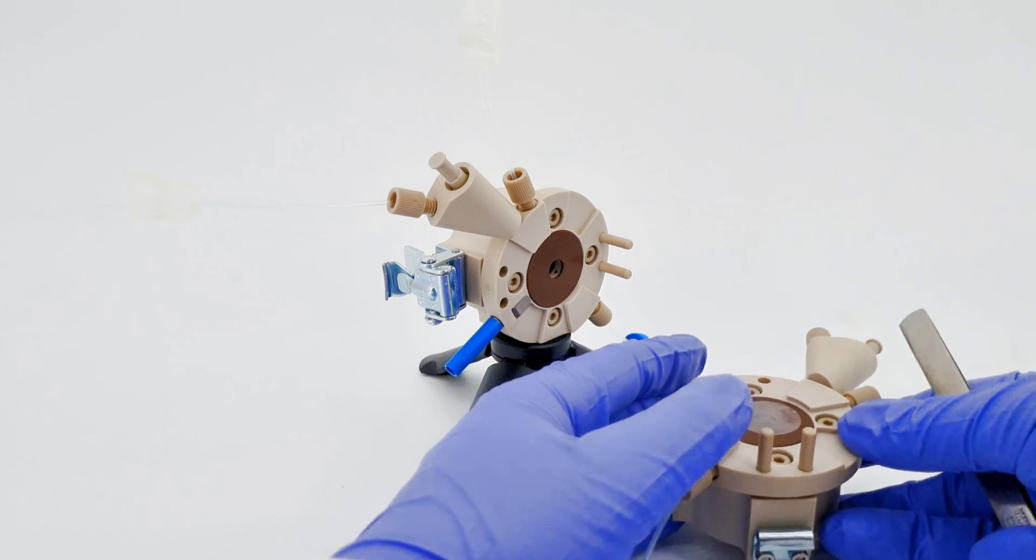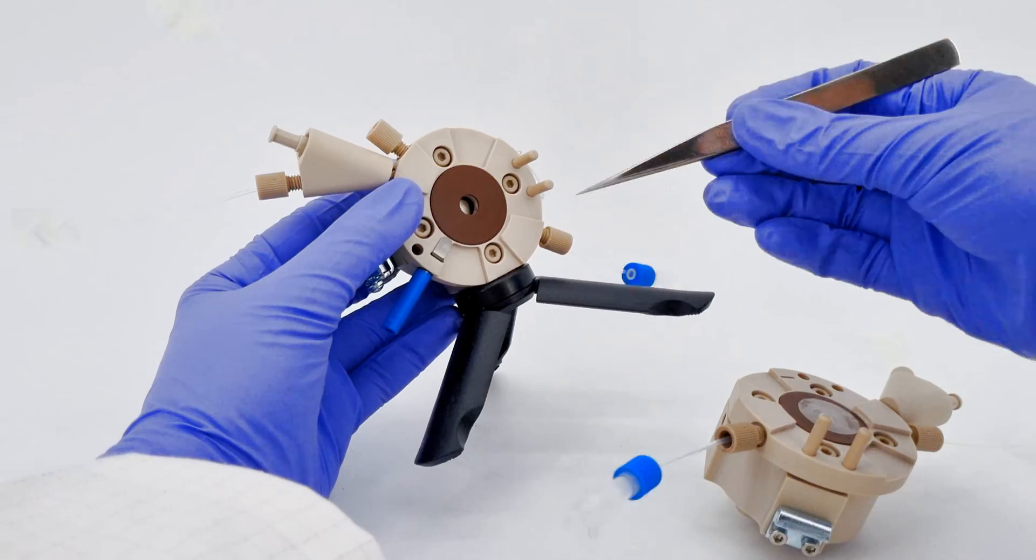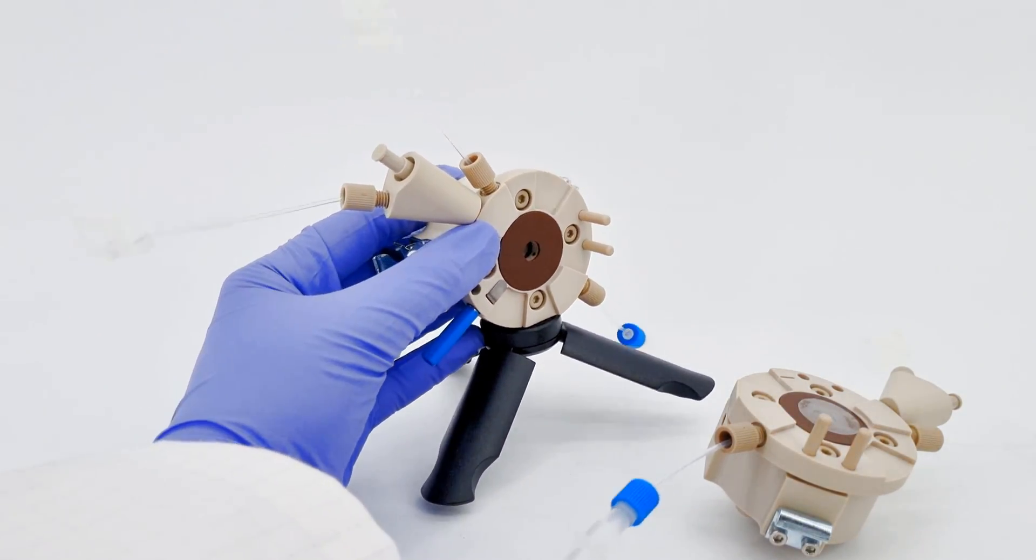For those conducting hydrogen permeation experiments, remember to connect this metal electrode to the tantalum clip.